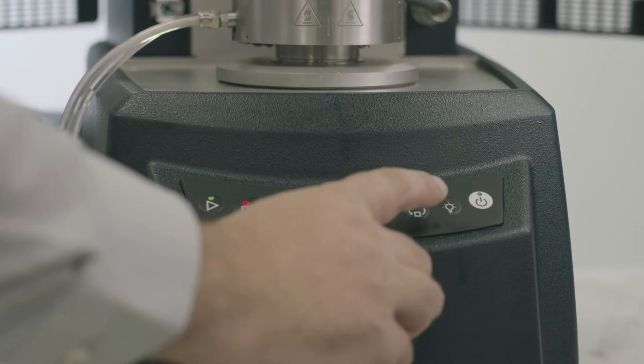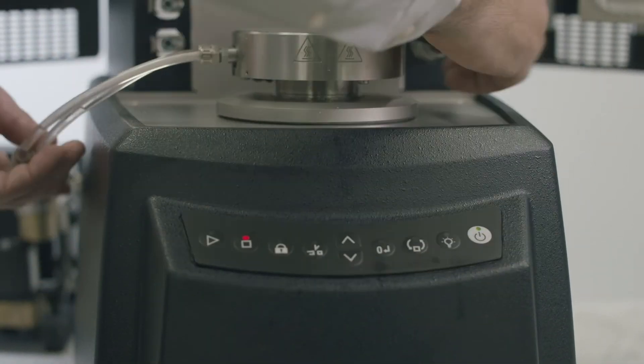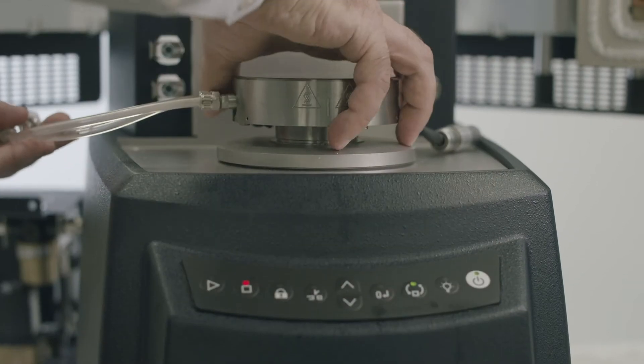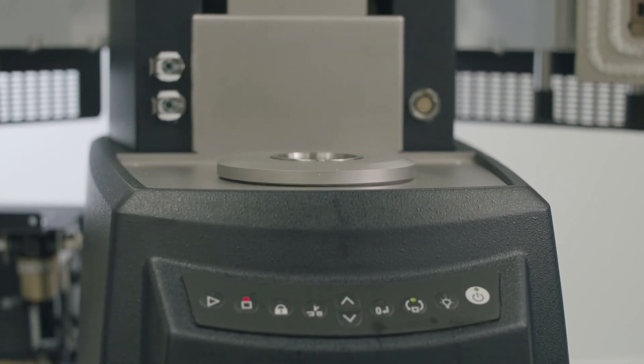There is no lower part of the geometry to mount on the magnetic base. Remove any existing fixtures from the base by pressing the geometry swap button on the front of the instrument to release the magnet.